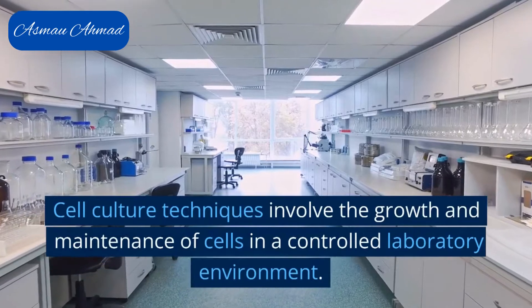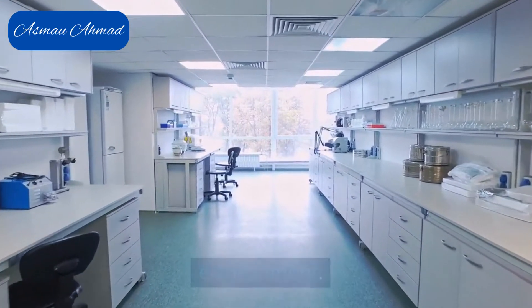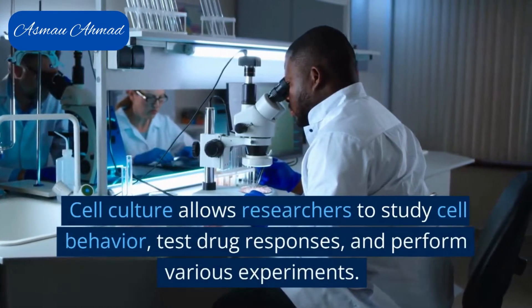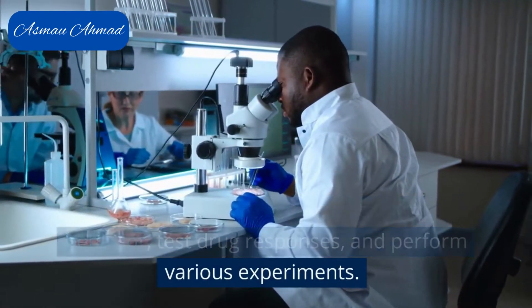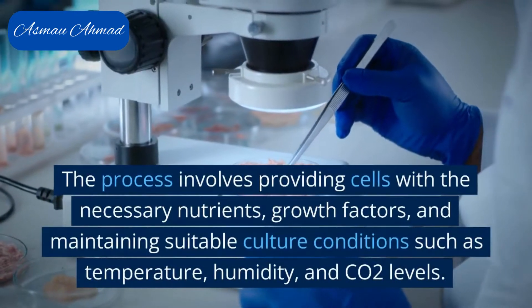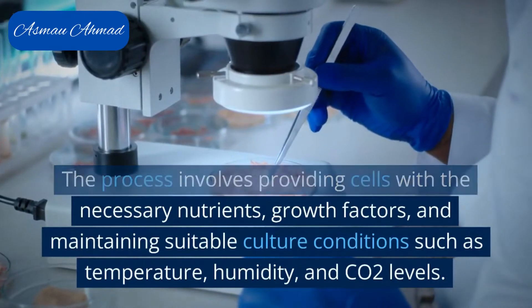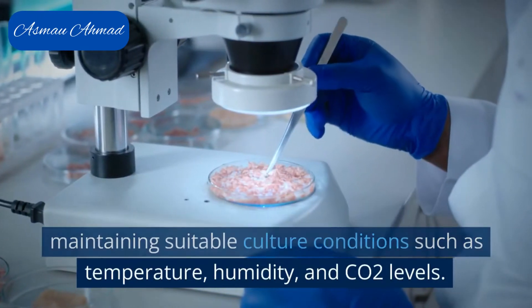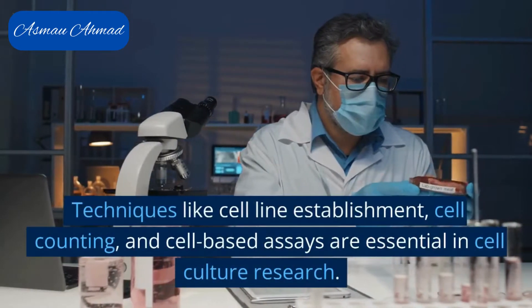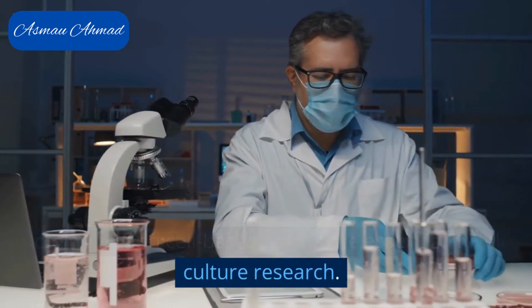Cell culture techniques involve the growth and maintenance of cells in a controlled laboratory environment. Cell culture allows researchers to study cell behavior, test drug responses, and perform various experiments. The process involves providing cells with the necessary nutrients, growth factors, and maintaining suitable culture conditions such as temperature, humidity, and CO2 levels. Techniques like cell line establishment, cell counting, and cell-based assays are essential in cell culture research.